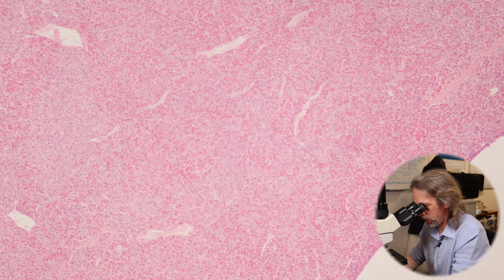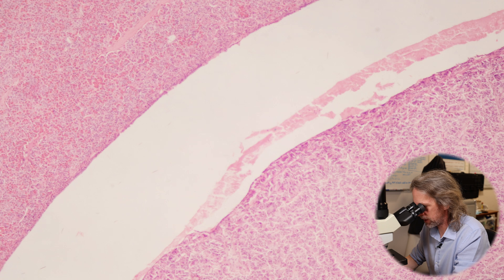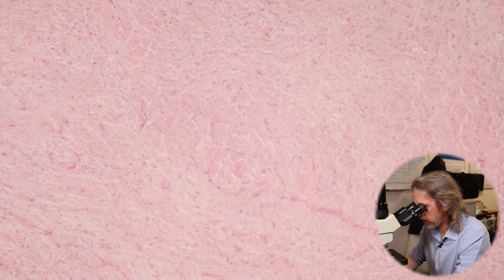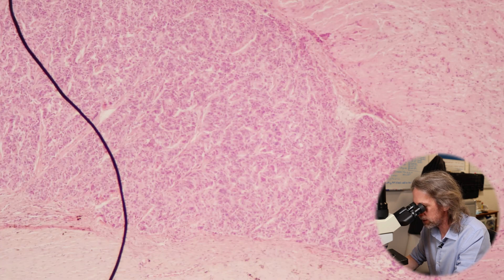We're right on the gap here — there's the pars nervosa, which looks very nervy with not a lot of cells. This is a hematoxylin and eosin stain, so nuclei will stain dark purple and cytoplasm will stain pink or purpley. There's not a lot of stain there, so we've got lots of nervous tissue. There's also a nice big blood vessel here.